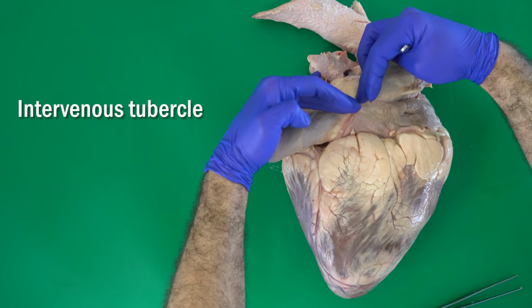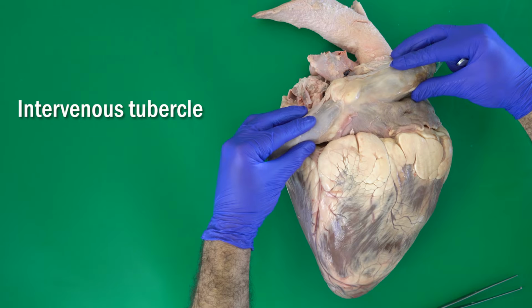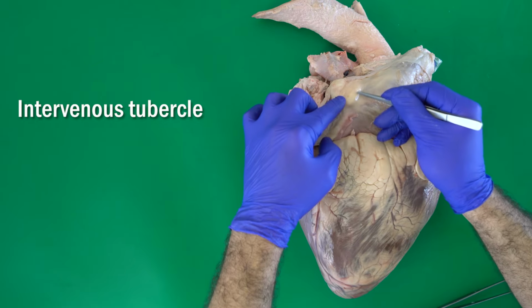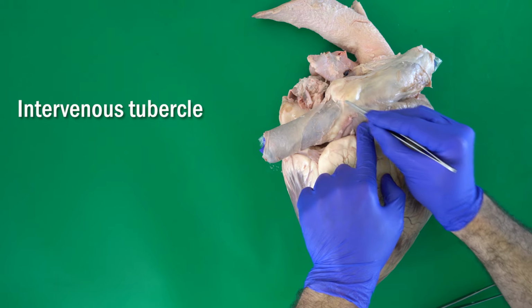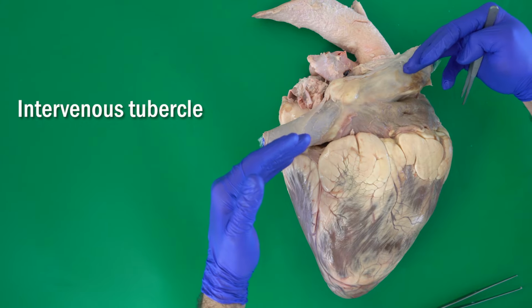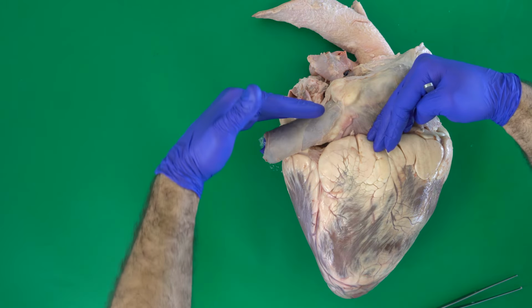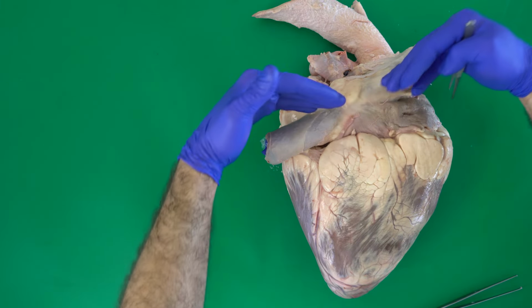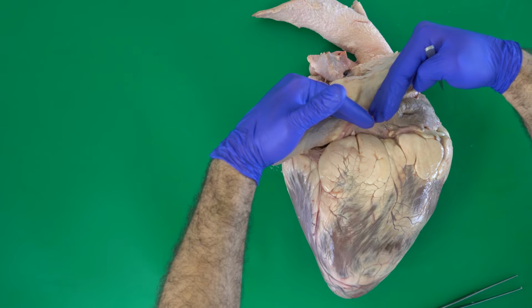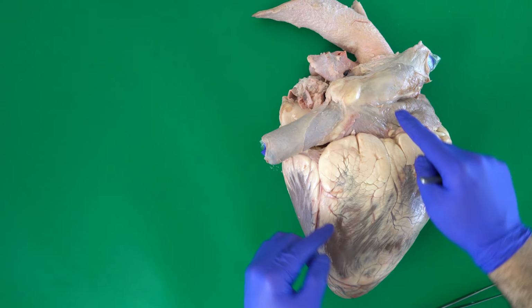tubercle, or a transverse ridge of tissue between the opening of the two vena cava, the cranial and the caudal vena cava. This tubercle or this tissue here is organized in such a way that the blood coming from the head and the forelimb or from the neck will be directed toward the right atrium. The same for the caudal vena cava. So the blood coming through the vena cava will be directed, because of this transverse ridge here, toward the right atrium.